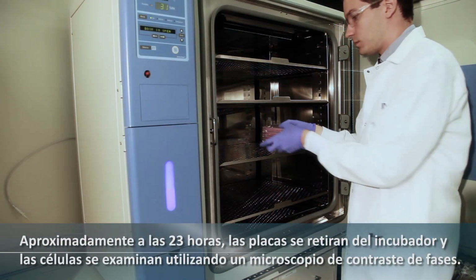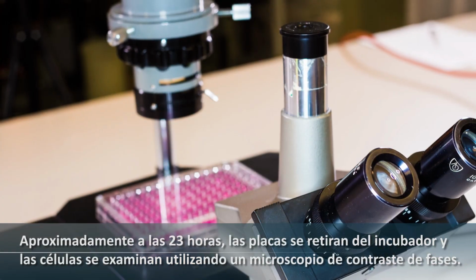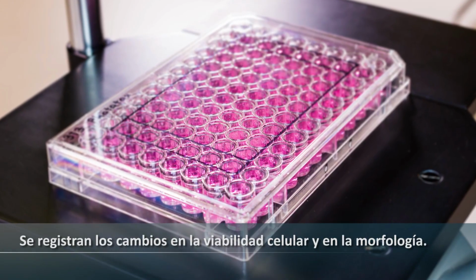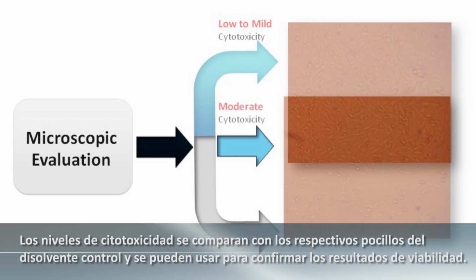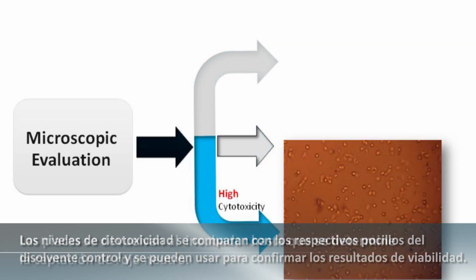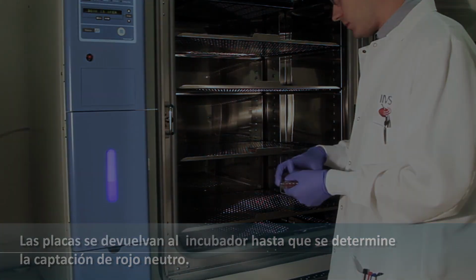After approximately 23 hours, the plates are removed from the incubator, and the cells are examined using a phase contrast microscope. Changes in cell viability and morphology are noted. The levels of cytotoxicity are compared to respective solvent control wells and may be used to support the viability results. Plates are returned to the incubator until the neutral red uptake endpoint.